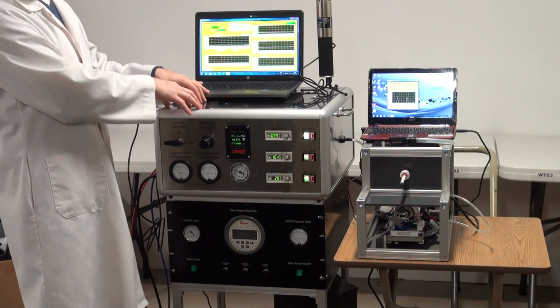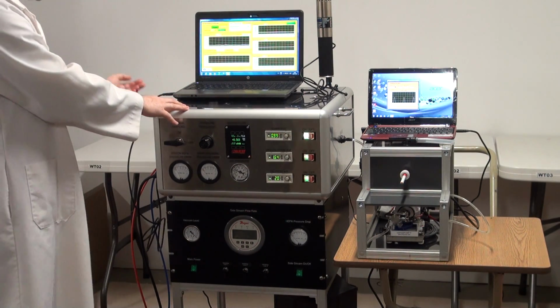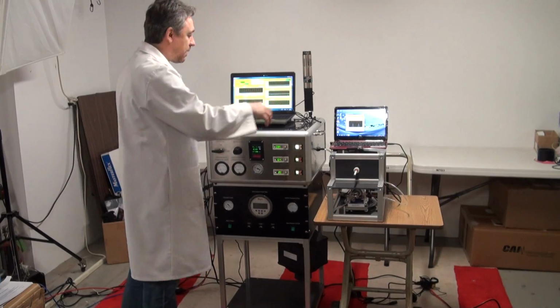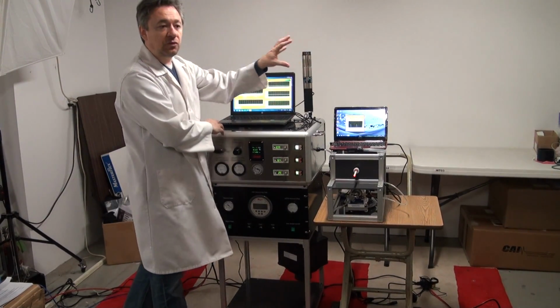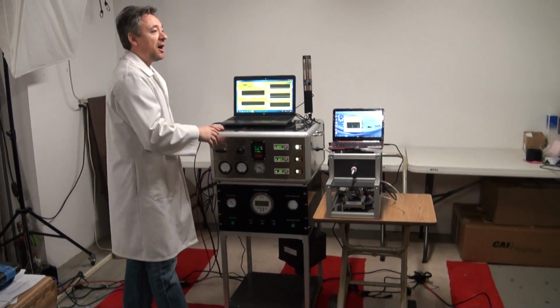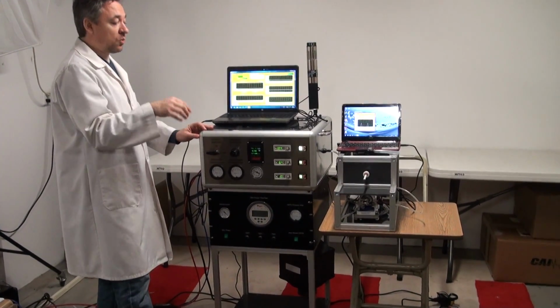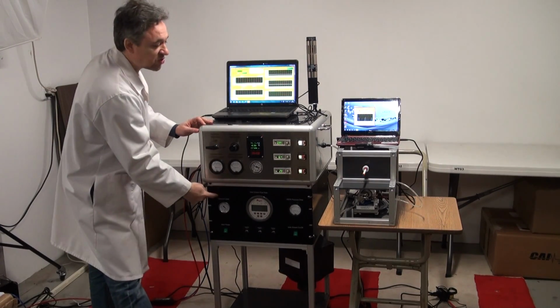Now the control of the concentration can be done inside the unit, which means that it controls the concentration at the outlet of the siphon, or it can be done remotely by removing the aerosol monitor from here and connecting it to the inhalation tower or exposure chamber in a remote location, and then sending the signal back. In that latter case, what we're actually controlling is the concentration of the mixed smoke.